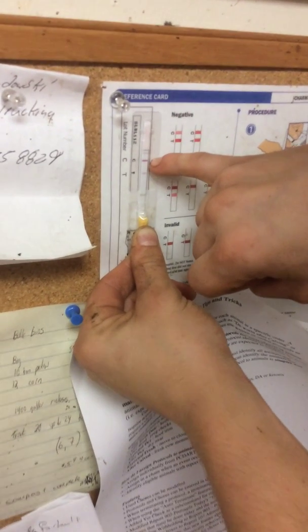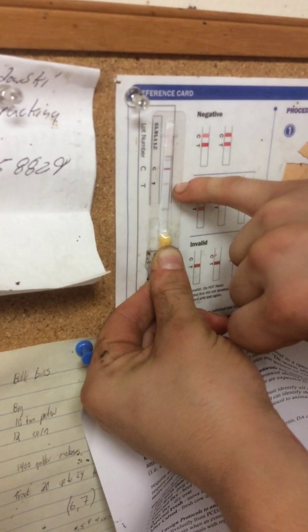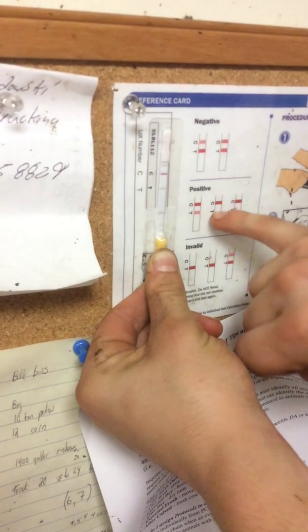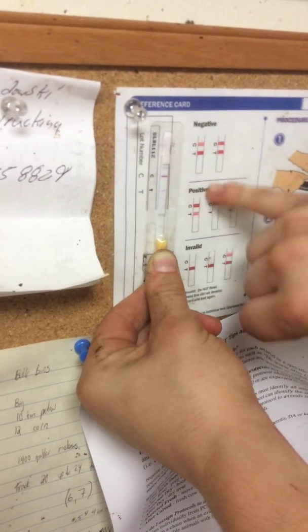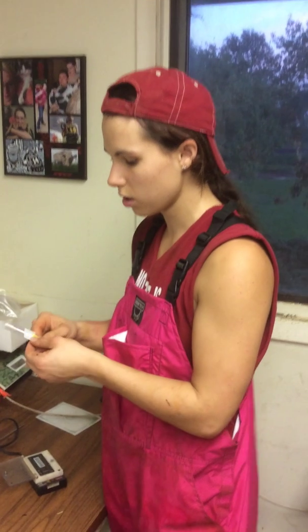Here it looks like the top line is a little bit darker than the bottom line, so if we match that up with the chart, this is positive. Since it's positive, that means there's some trace of antibiotics in the milk still, so this cow will stay a red band — we'll leave the red bands on and chart her, then test again probably in the morning or tomorrow afternoon.